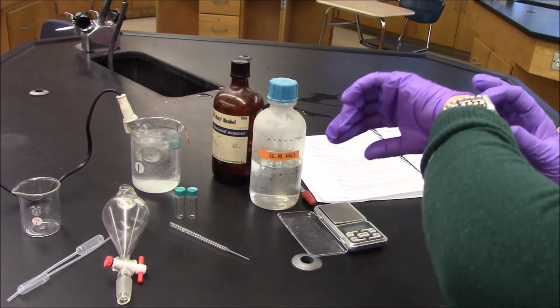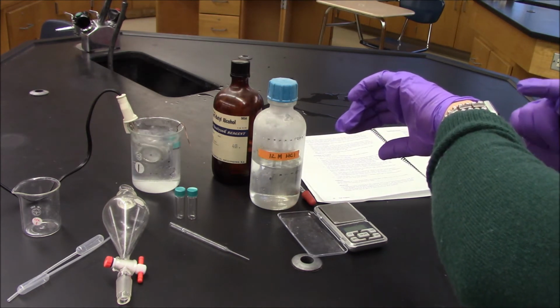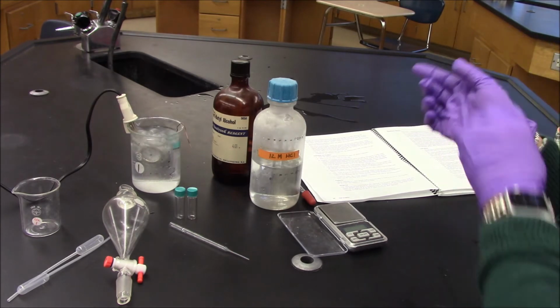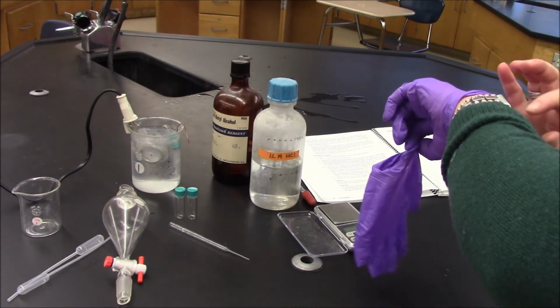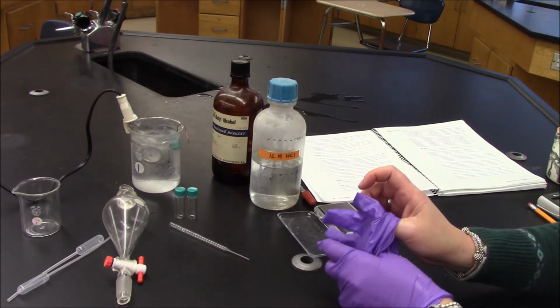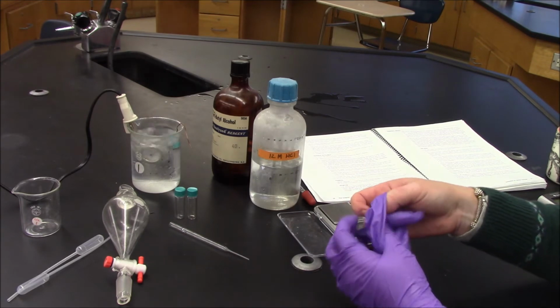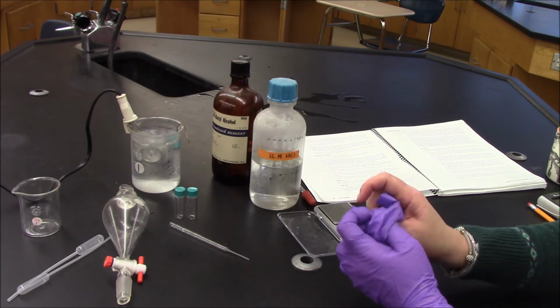Okay. It says to start this initially for a few minutes, 2 to 3 minutes. So set a timer for 3 minutes. My watch is unhappy because I have gloves on. There we go. After 2 to 3 minutes, I'll make sure that the reaction vial is still sealed tightly. And then I'll put it back in for a 20-minute incubation period.